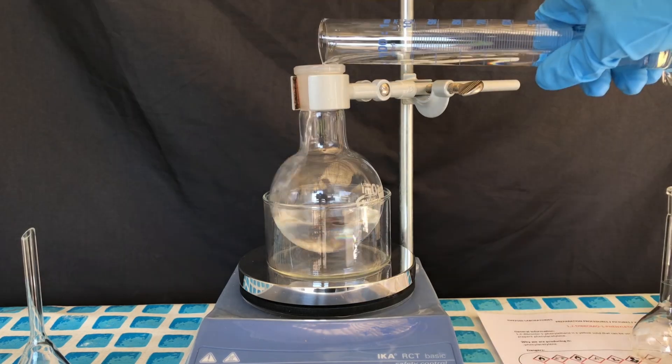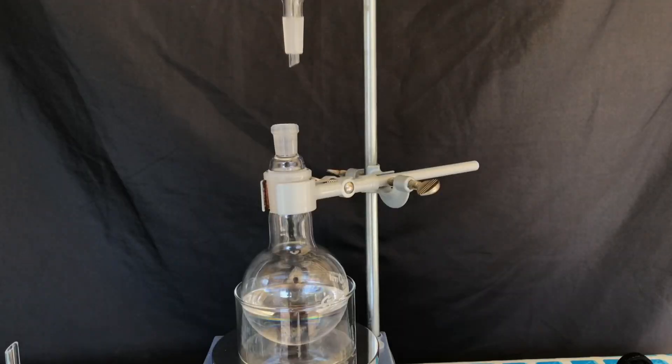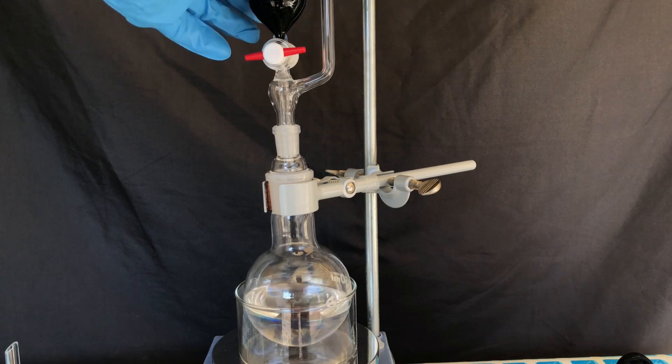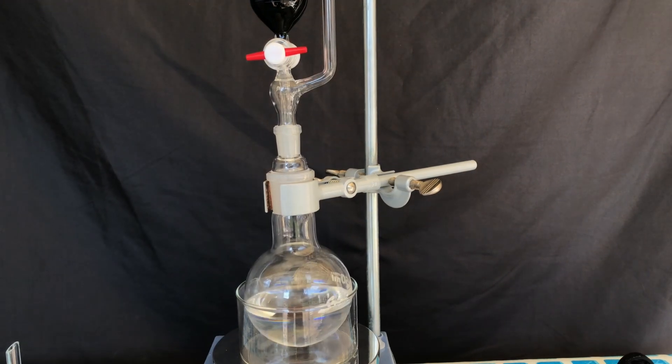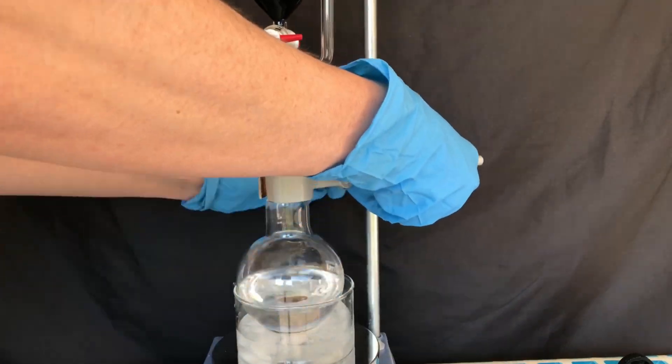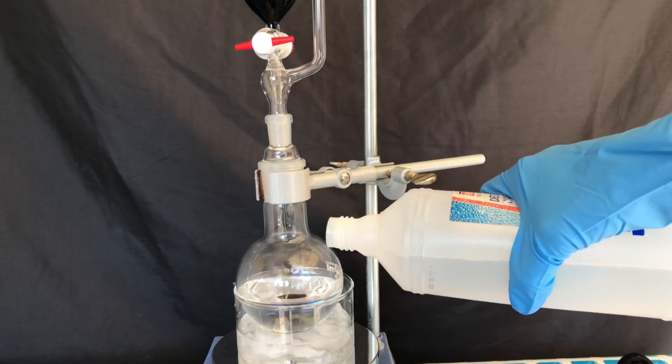To make the cleanup a little easier, we ended up rinsing the measuring cylinder with the dichloromethane. The apparatus was put together and now we were able to begin. To ensure that everything will stay cold, an ice bath was set up.